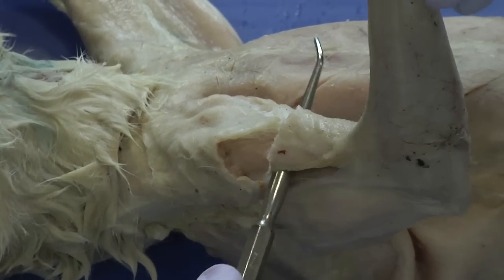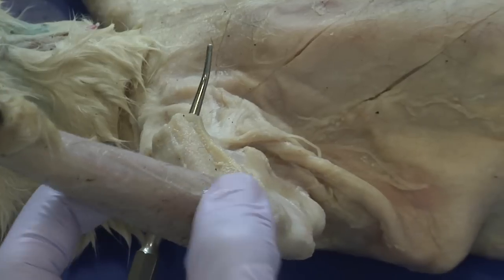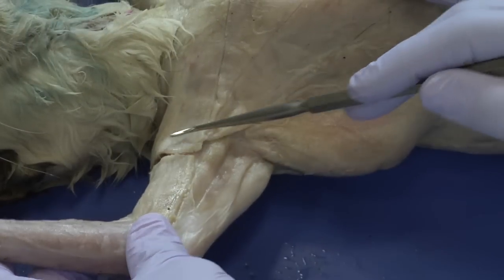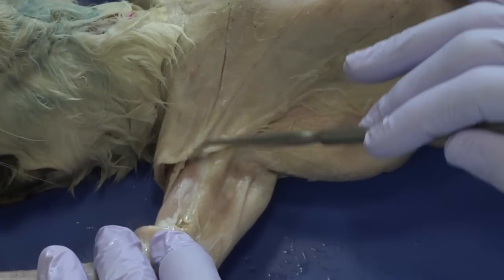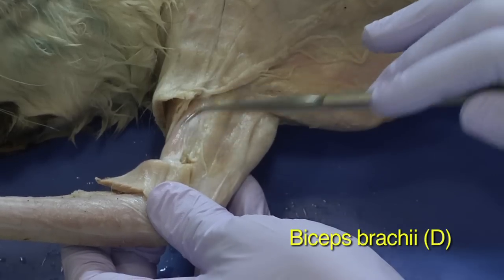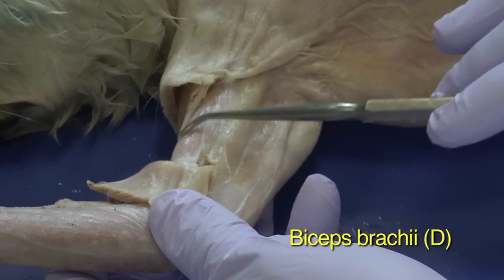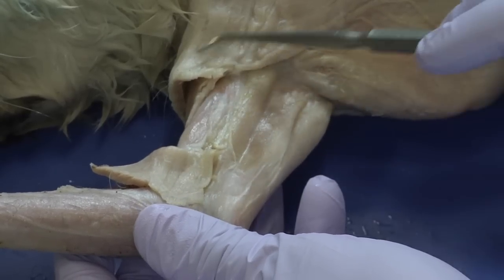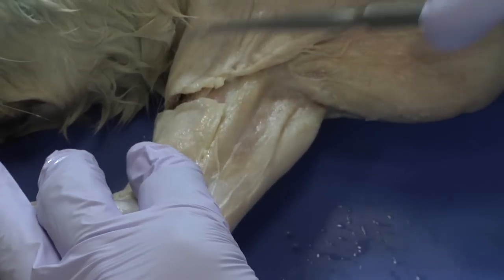I've been able to bisect that muscle. I'll clean up just a little bit of the connective tissue. We have bisected this muscle, and if we reflect it back, we can see the biceps are now revealed. The biceps are a deep muscle, so you'll have to get to them by cutting the muscle that is superficial to them.